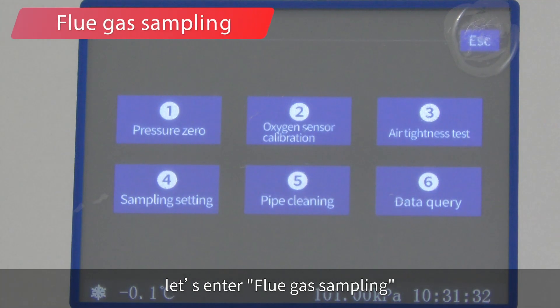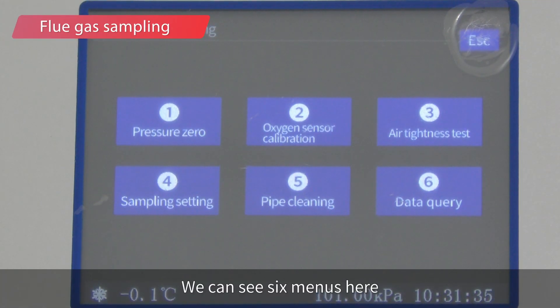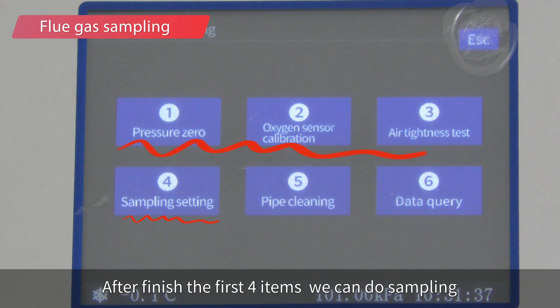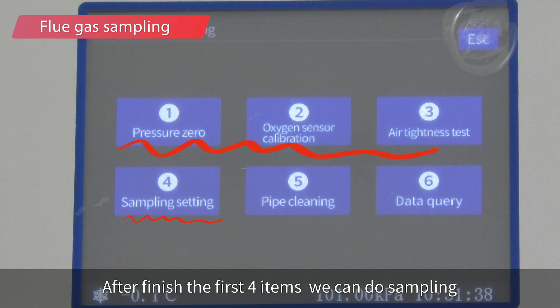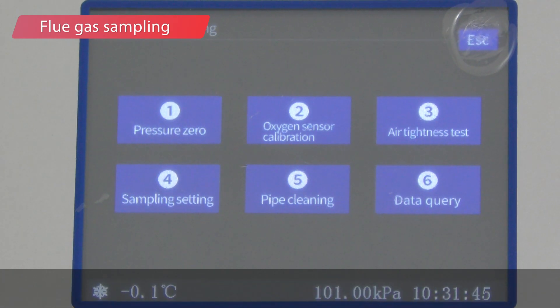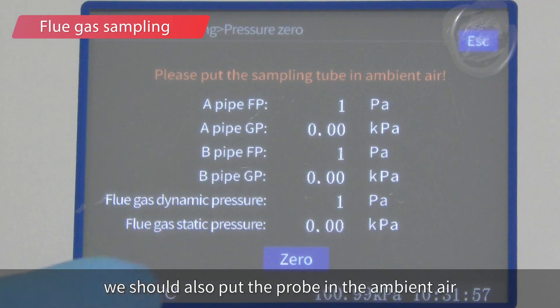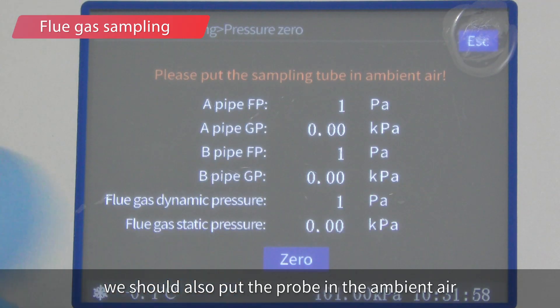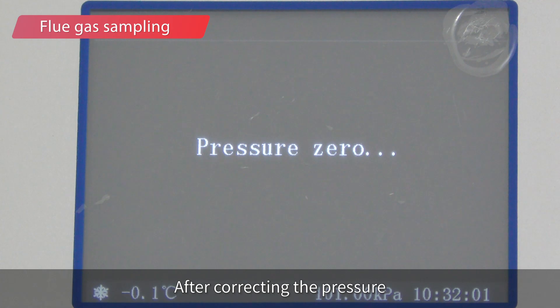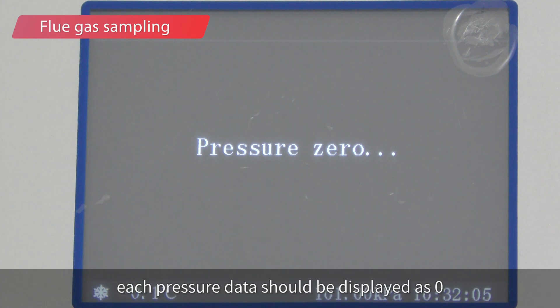Now let's enter flue gas sampling. You can see six menus here. After finishing the first four items, you can proceed to sampling. For the pressure zero step, also put the probe in ambient air. After correcting the pressure, each pressure data value should display as zero.